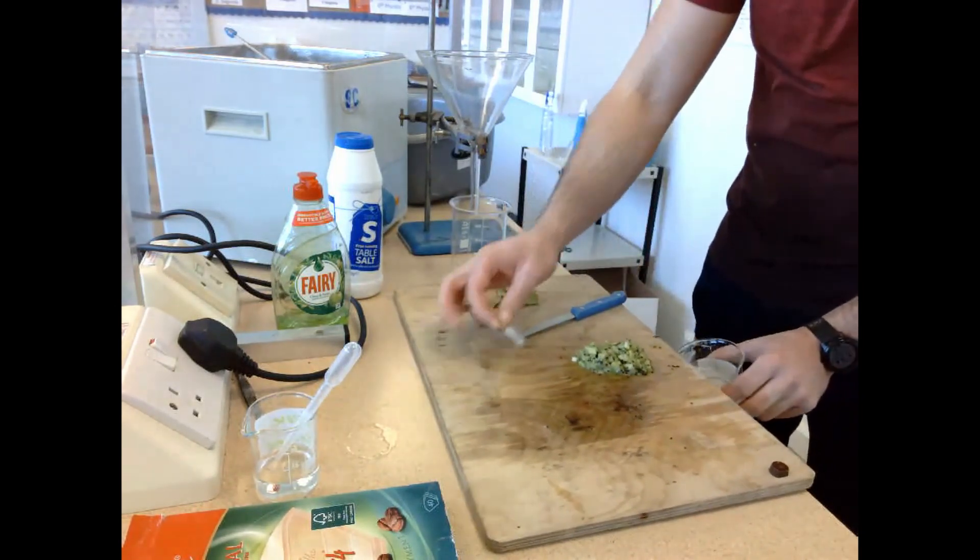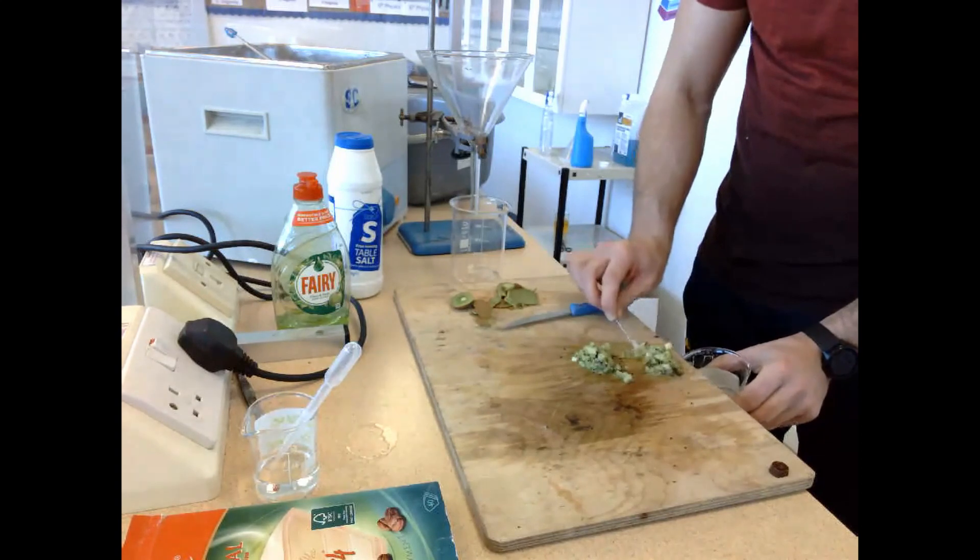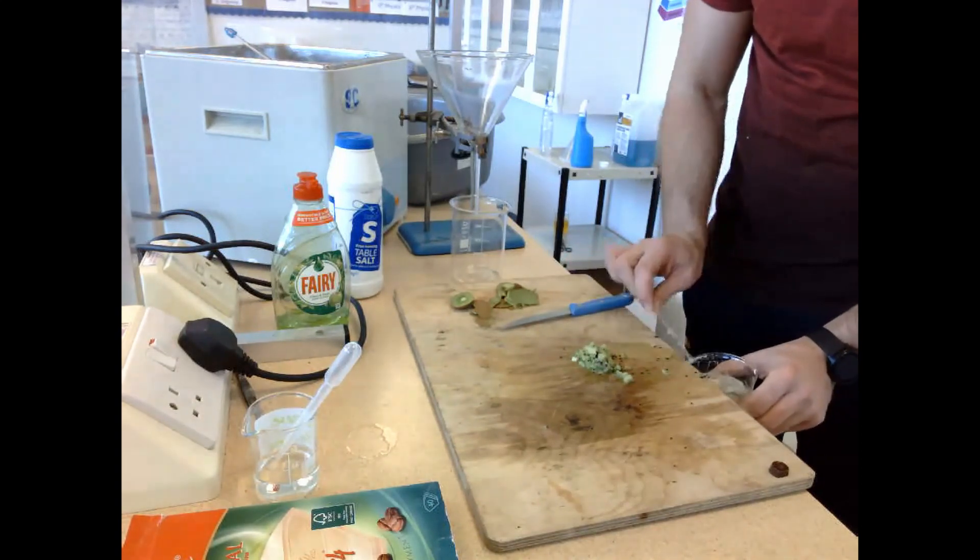The water bath is at 60 degrees, because this will denature any enzymes that will be present that would break down the DNA.